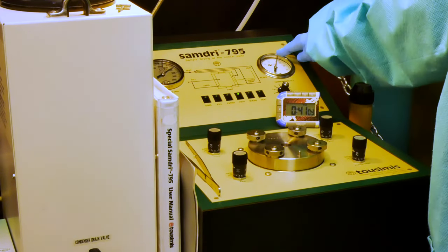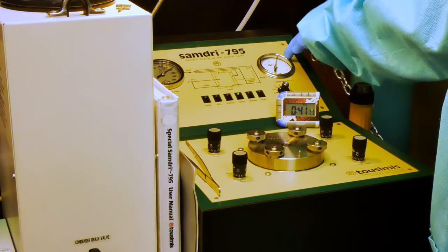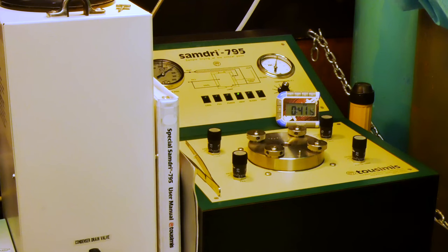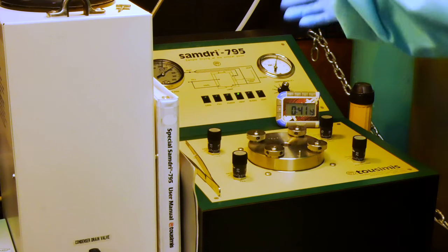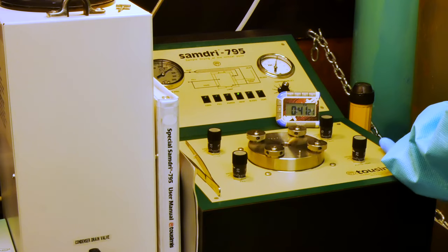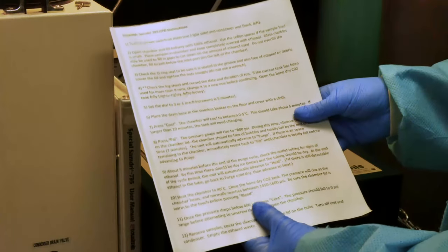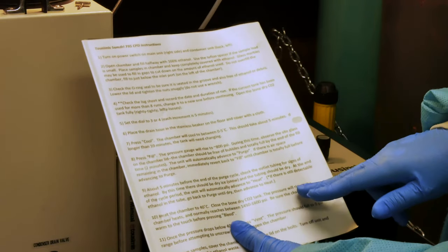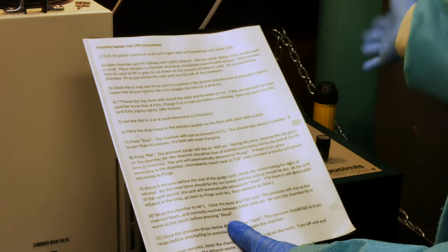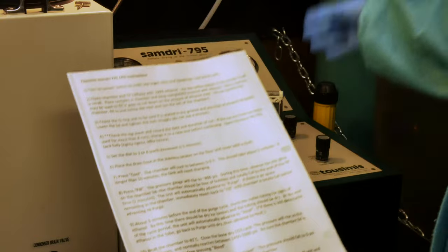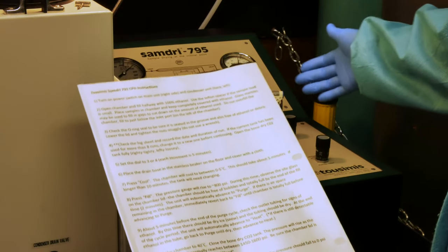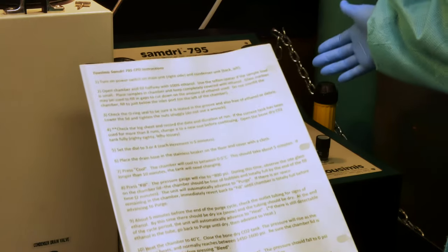The temperature has gone up above 40 and is actually starting to decrease. As I mentioned before, I'm going to give it a moment or two before I then hit bleed, but that will be the next step. There we go. All right. So, we have reached critical point. We have reached critical temperature. Critical temperature has started to decline, and we're at 43 minutes. So, we're about seven minutes being at isothermous equilibrium.